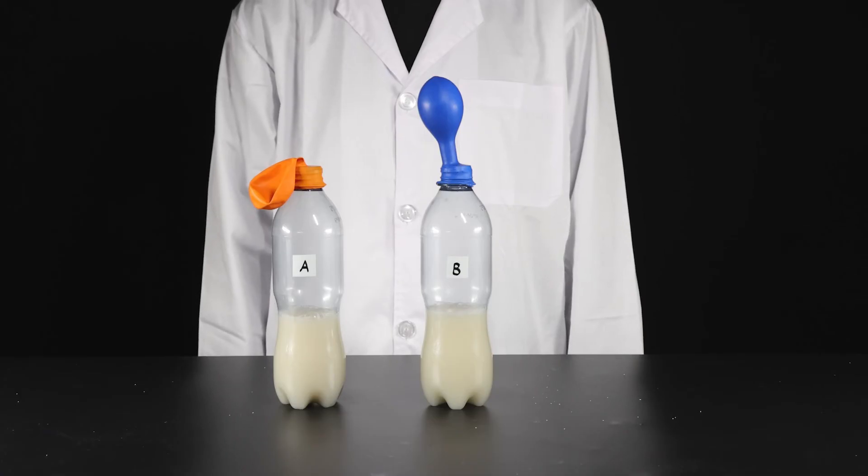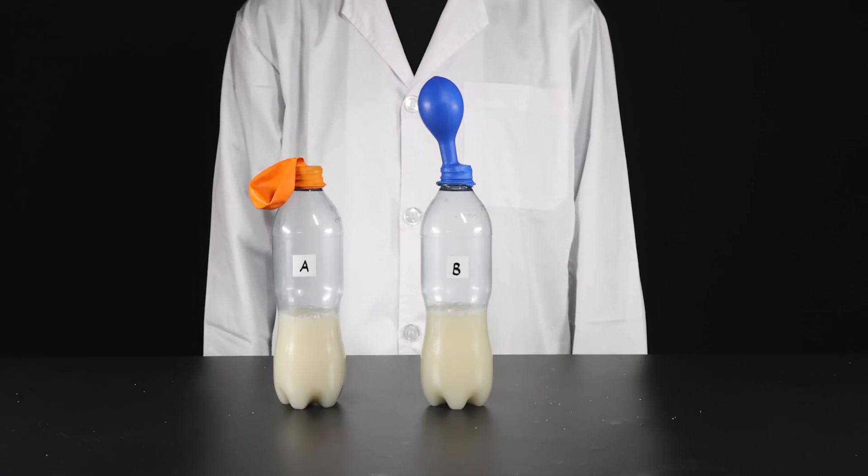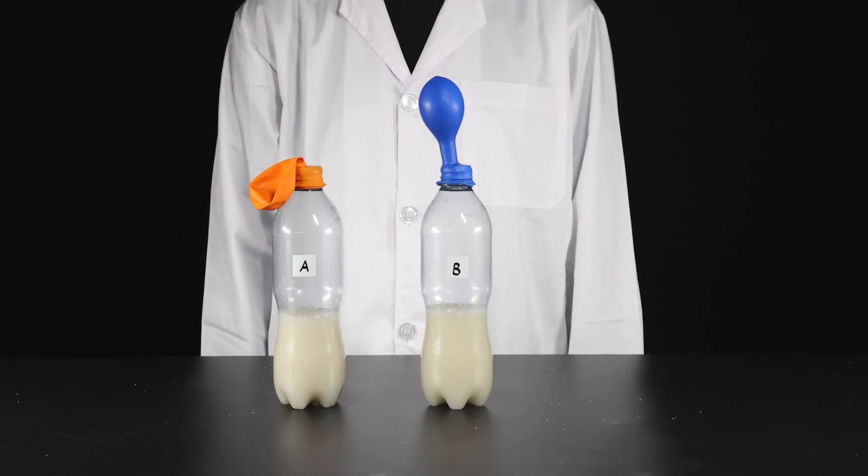Balloon B has inflated while the balloon on bottle A hasn't changed. What can you conclude about the effect of glucose on the growth of yeast?